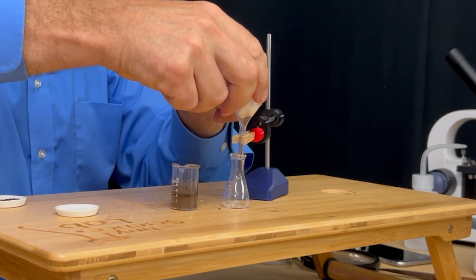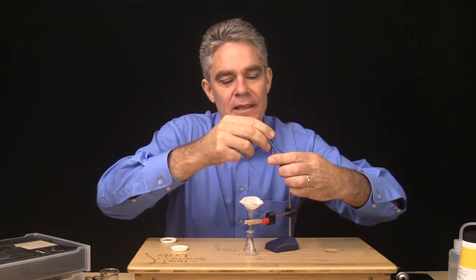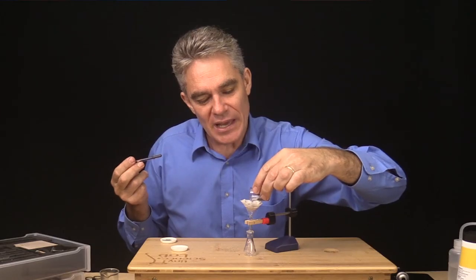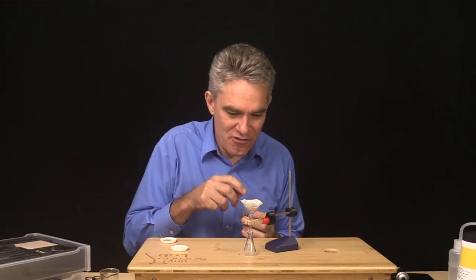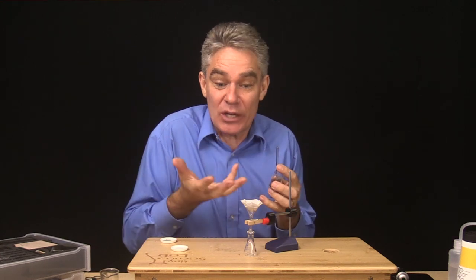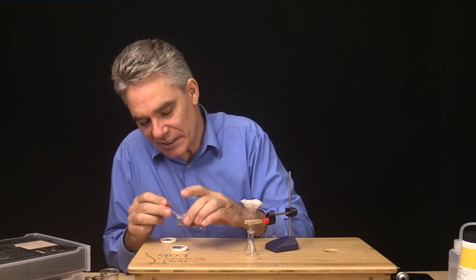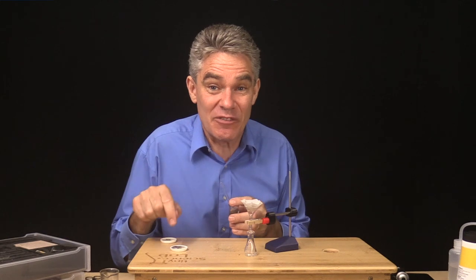I put the filter paper into the funnel, then get my mixture of sand and salty water and decant it into the filter paper. Very shortly we'll be able to see some clean water — called the filtrate — dripping through. There it is, I can see my first drop of clear water going through because the filter paper is blocking the sand. I've actually got a lot of the sand left over there. If I dry this mixture out I will be left with some sand — so using evaporation I can separate the water and be left with sand.